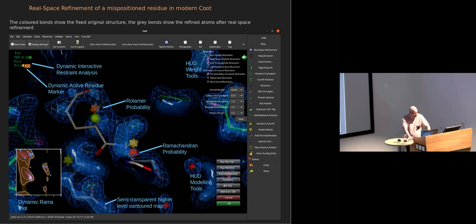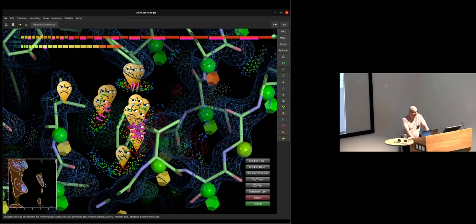I know not everybody can see colors, and there are plans in the irons in the fire to make that more readily interpretable for those who can't tell the difference between red and green, which is quite a high percentage of men. Right, and we can also analyze the structure as it's undergoing its refinement. And what this is, instead of writing information to the terminal, I'm writing information into the screen here. And of course, this is all done with the gaming techniques of textures and instancing.